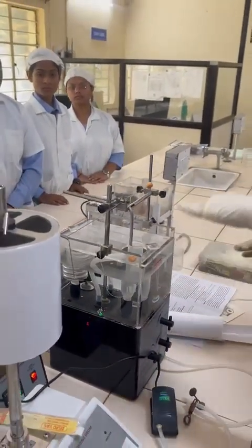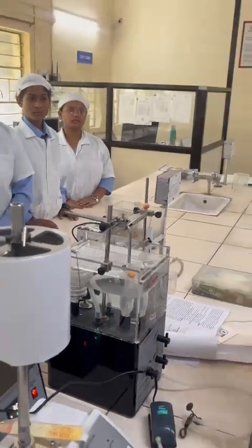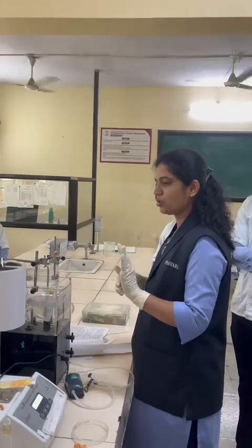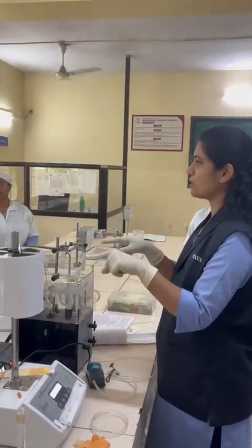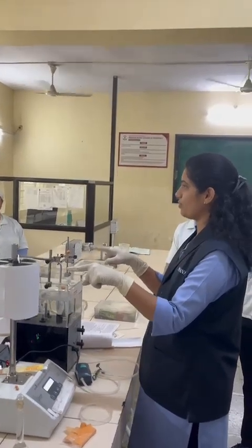So whenever there is washing, the load will be at the downside. After washing and before starting the baseline, you have to put this load on the top. So again, in the stabilization process, there will be an equal load balance of that lever.